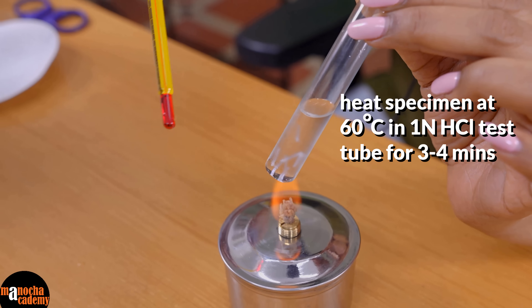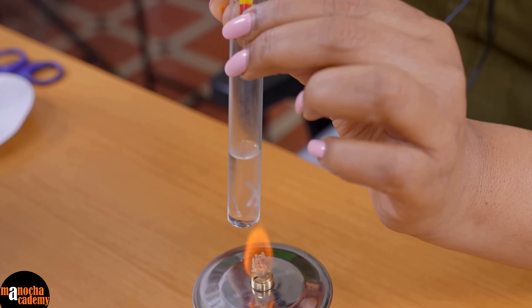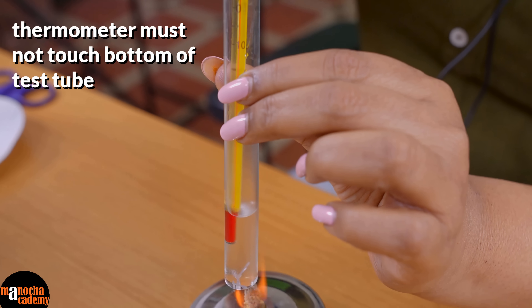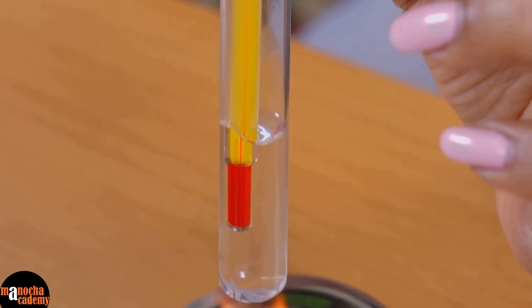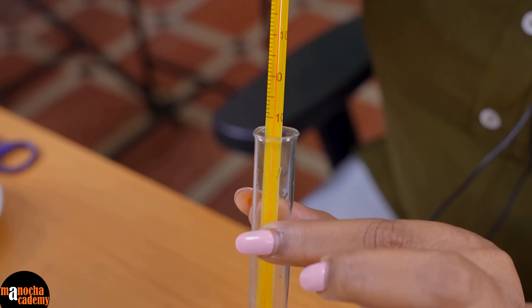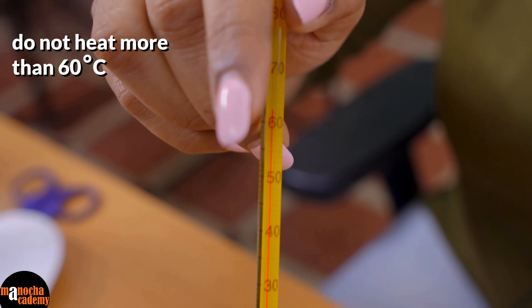For that we will be taking a thermometer. As you can see the thermometer reads around 25 degrees here. So when you heat it, you put the thermometer in. Make sure that the thermometer does not touch the bottom of the test tube and you will slowly see the temperature inside rise. The temperature should reach around 60. The moment it reaches 60, we will not hold the test tube there, because if it reaches 60 and you hold it there, it will cross 70.